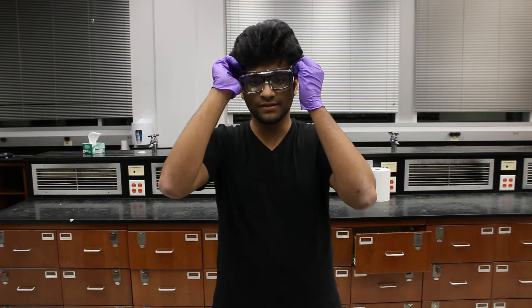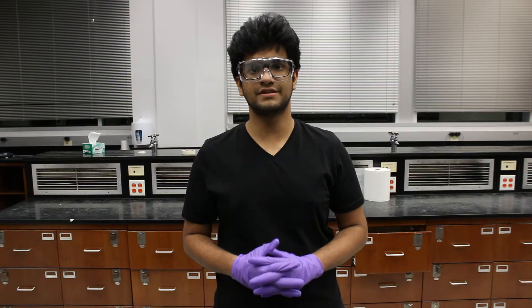Make sure to follow lab safety procedures while performing this experiment. Always wear your safety glasses and gloves. When you come to the lab, make sure you wear full-length pants and shoes that cover your entire foot.